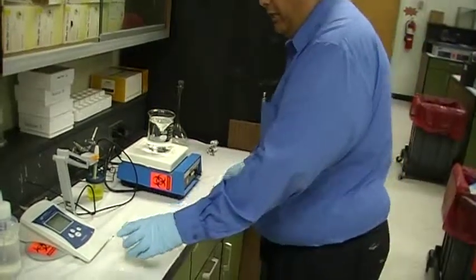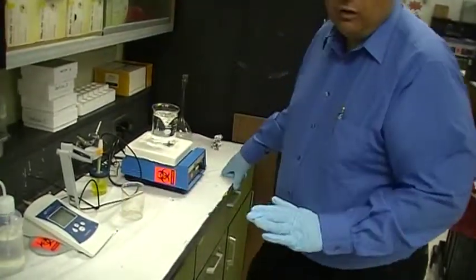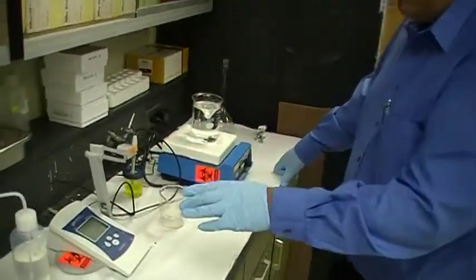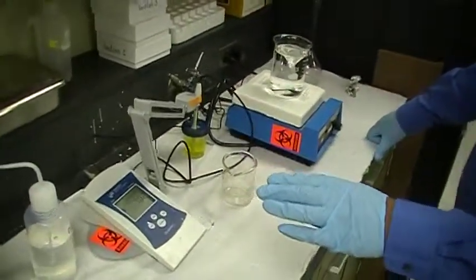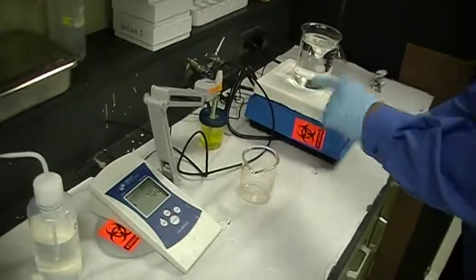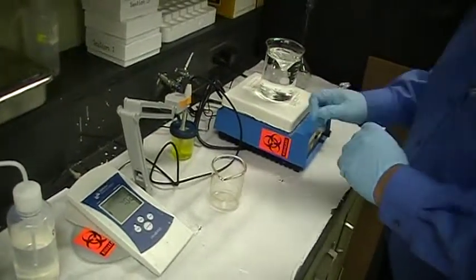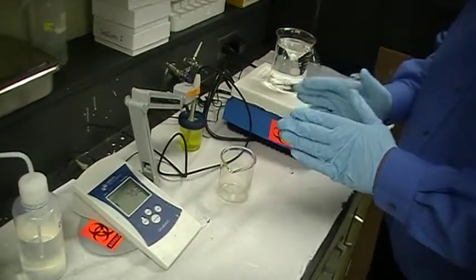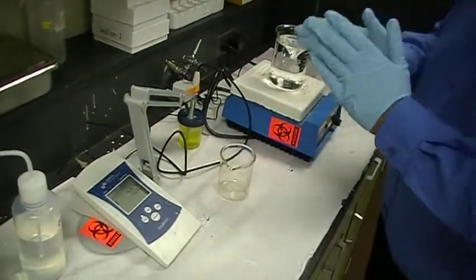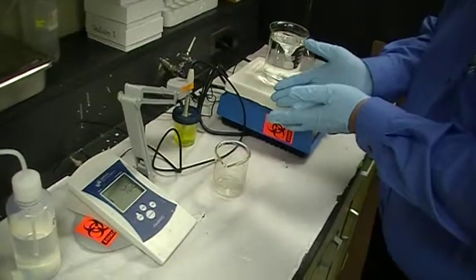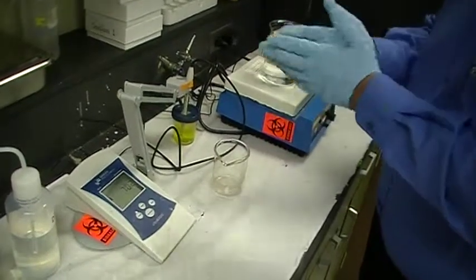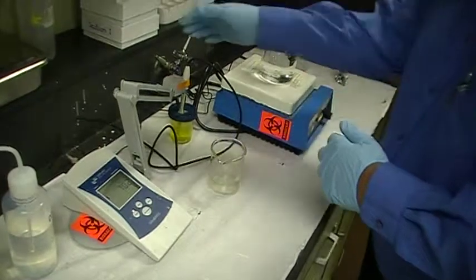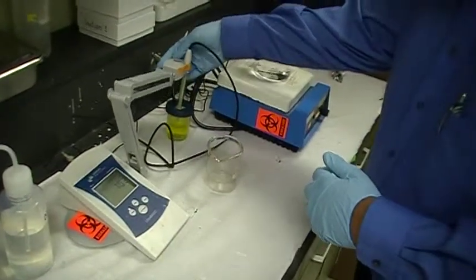Then you come to the pH meter. The pH meter is always on. And it's always stored either in a storage potassium chloride solution or in a standard buffer. And so the first thing you need to do is you need to standardize it. And you usually need two pH standards. But since we only have one pH standard, we're going to standardize using this one single pH standard. And so you pull it out of that solution.